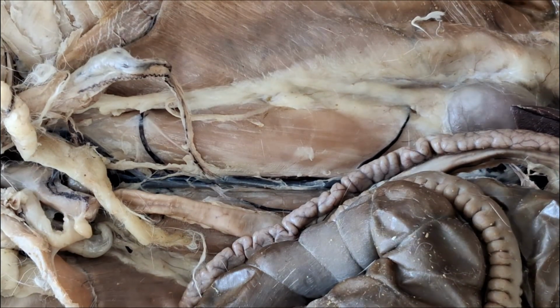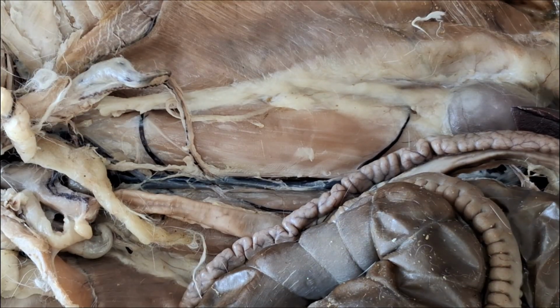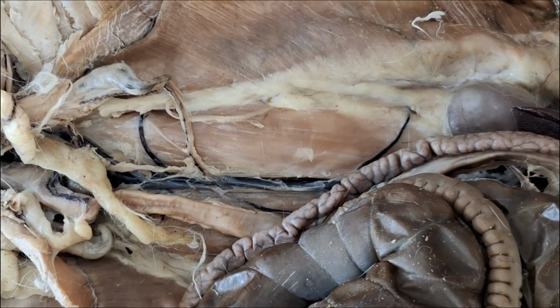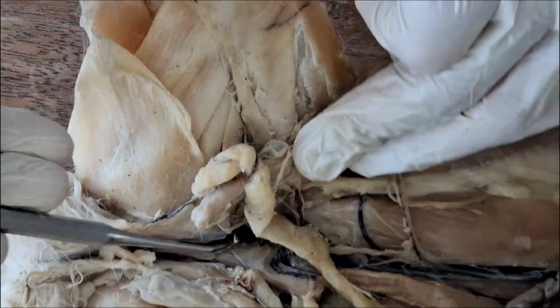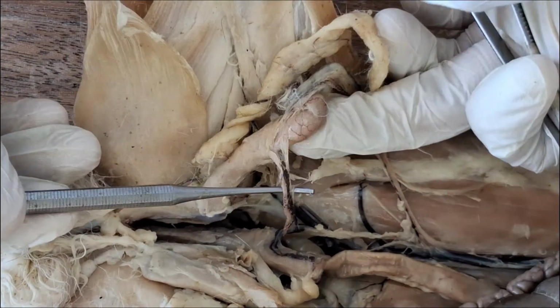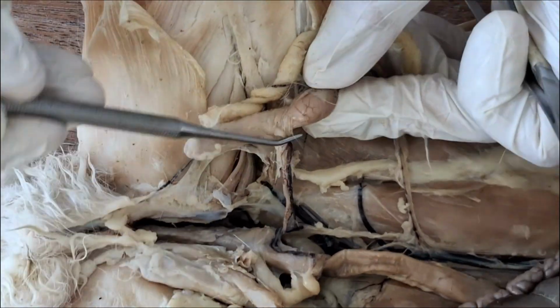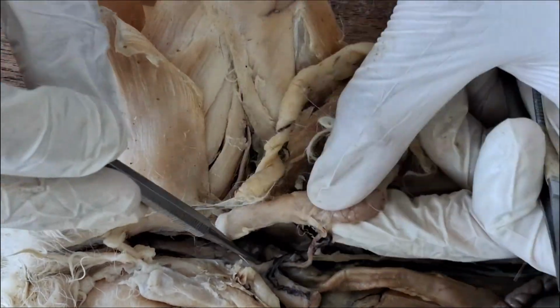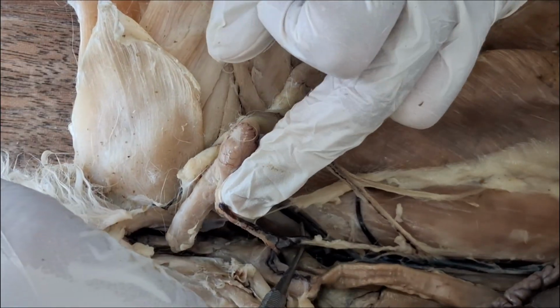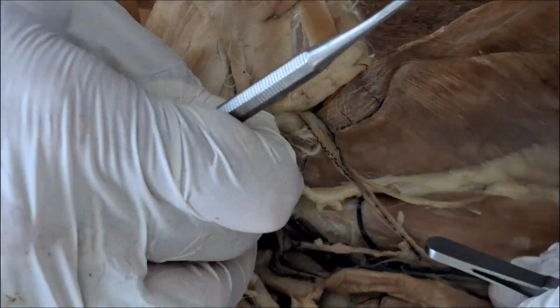There's another spermatic vein, but unlike the internal spermatic, it doesn't drain directly into the postcava. I'll show you later. Actually, it's this one. You see, there's another vein draining the testes, but it doesn't drain directly to the postcava, but instead it drains into the external iliac. So let's first examine the other tributaries.